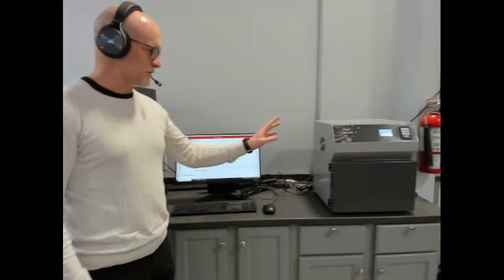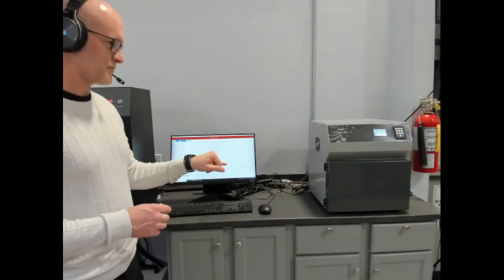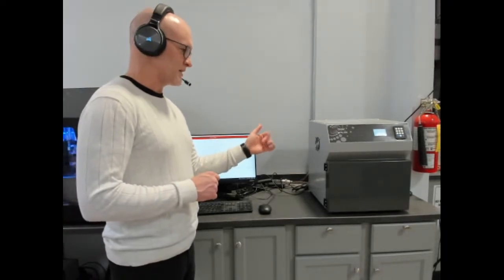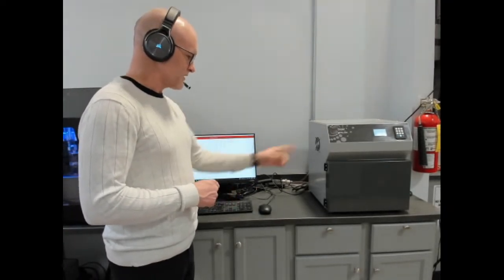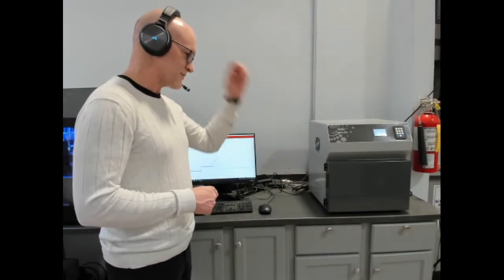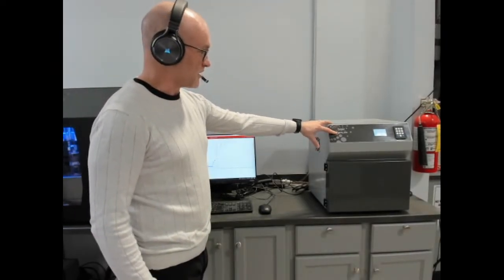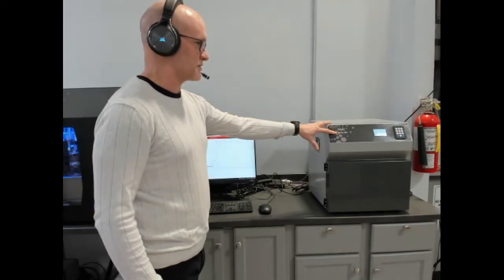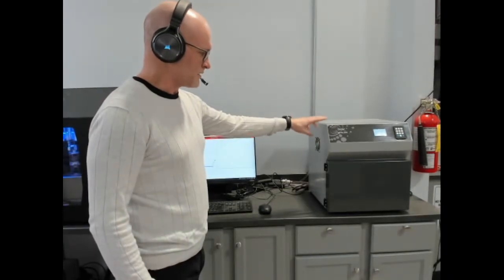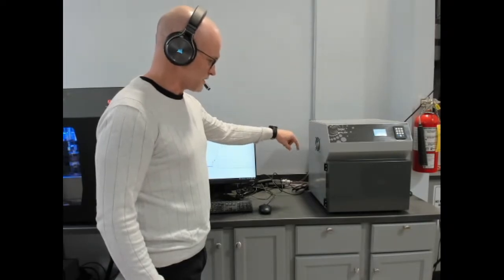And then we have our heat flow meter, one of a few. This is our HFM100. This has a plate temperature of -20 to 75 Celsius, and this is for measuring large format insulation and construction materials. This one has an inside dimension of 300 by 300 and up to 100 millimeters thick. The thickness can vary, of course. We have a high temperature version of this that has a plate temperature of -30 to 110 Celsius and the exact same internal dimensions. And then we have the HFM50, which is 200 by 200 millimeters and up to 50 millimeters thick.